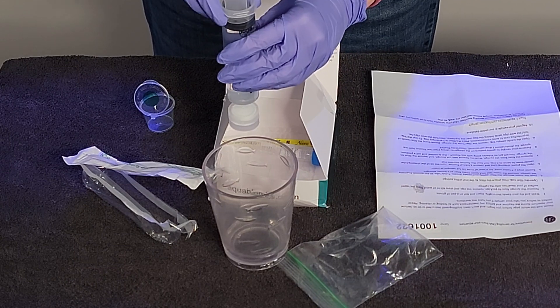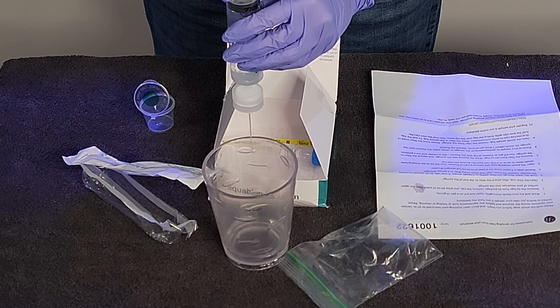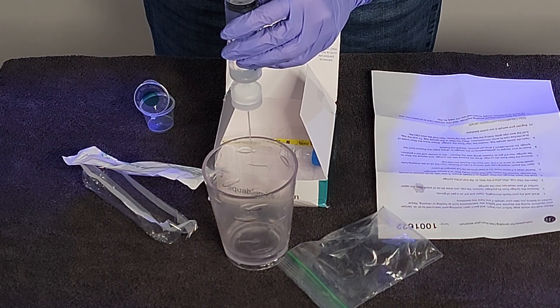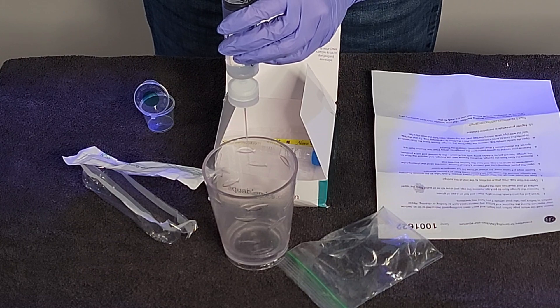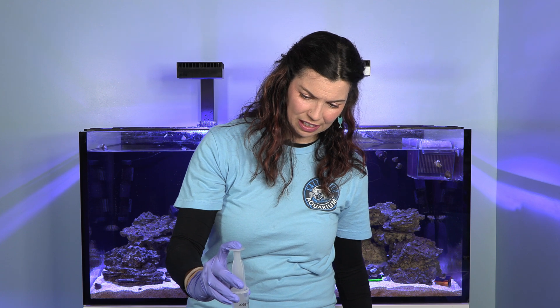As you are pushing the water through this filter, it's going to have to go somewhere, so get yourself a container — I've got a cup right here. We do this slowly; it might take a while. And then we have to do this whole process three times. As we are pushing the water through the filter, the DNA from the tank is getting trapped in the filter and the water is just going on through. This is syringe number two — I can already feel it's a little bit harder to press the water through than it was the first time.